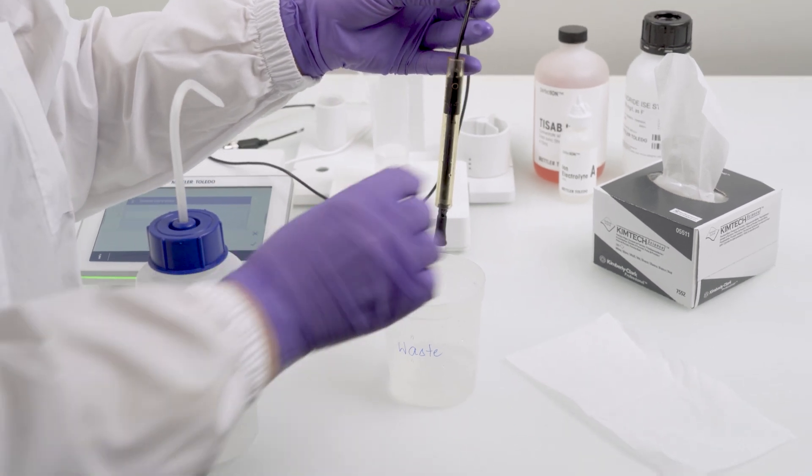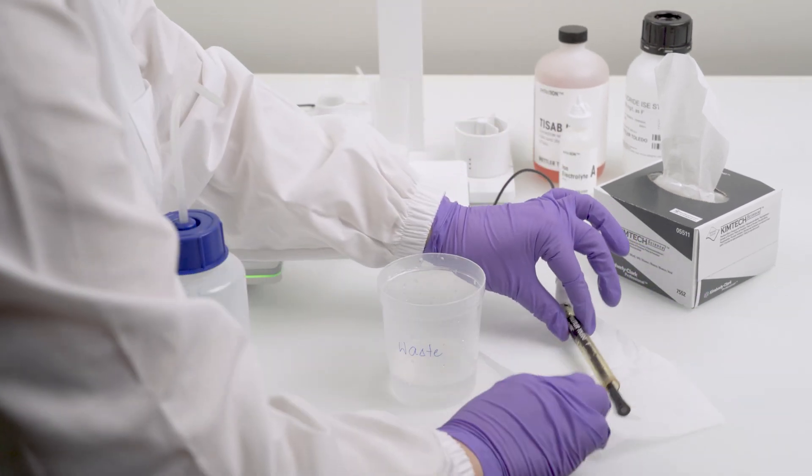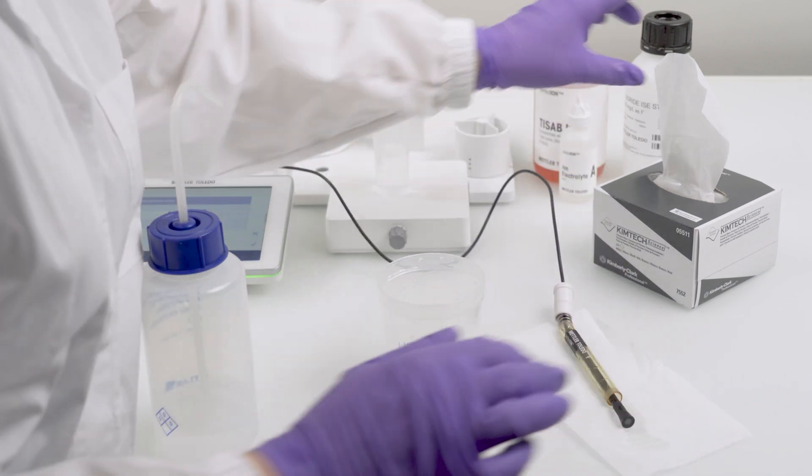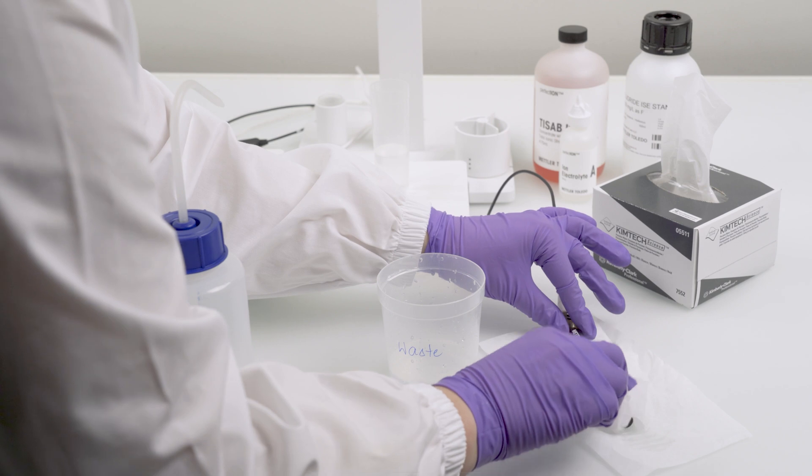For long-term storage, place the sensor on clean tissue paper and leave the sensor to dry. Reassemble the sensor once it's dry.